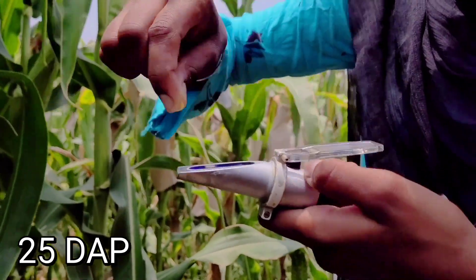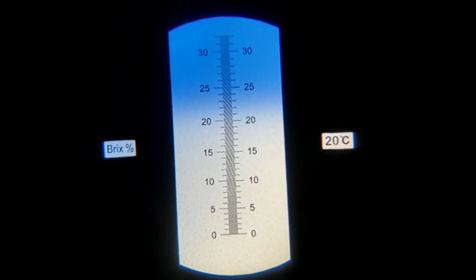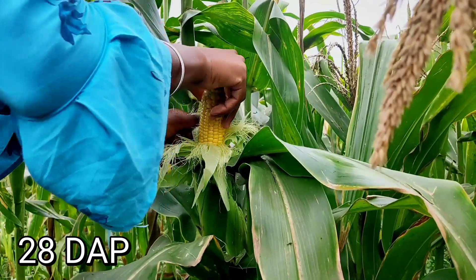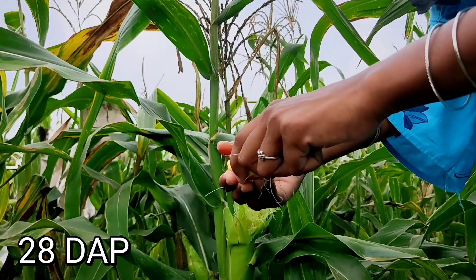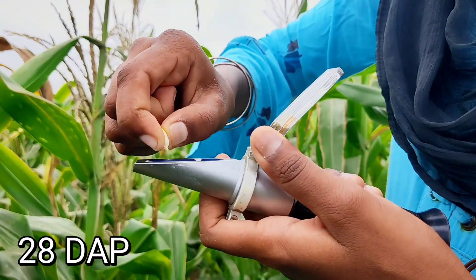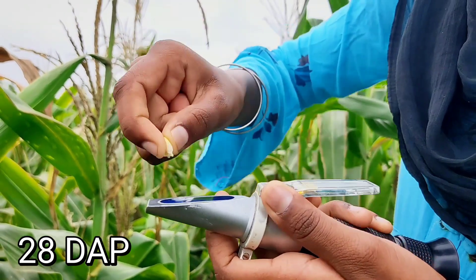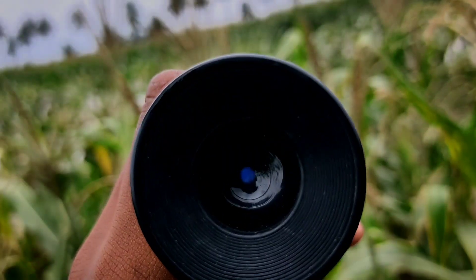The observed Brix value for the 25 days after pollinated cob is 20%. For the 28 days after pollinated cob, the kernels were collected, pressed with a finger, and the clear liquid is placed over the prism of the Brix meter, kept perpendicular to sunlight. The Brix value is recorded.